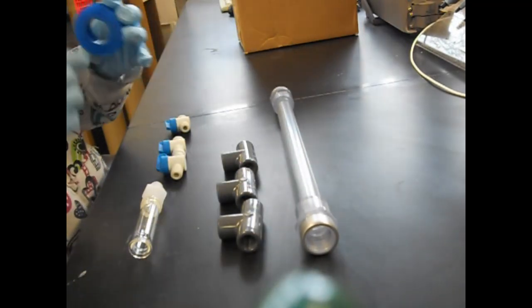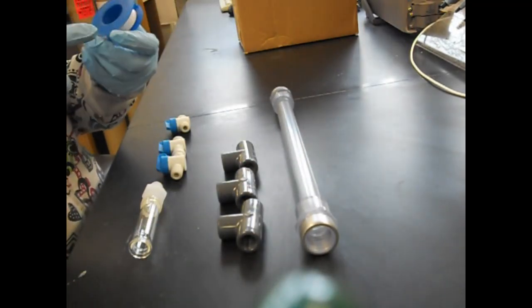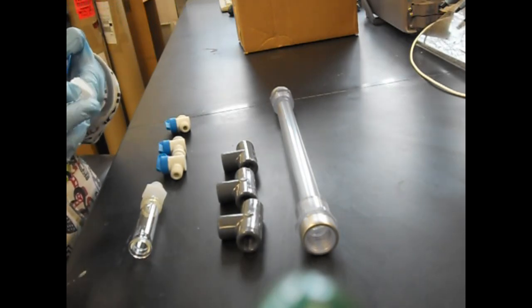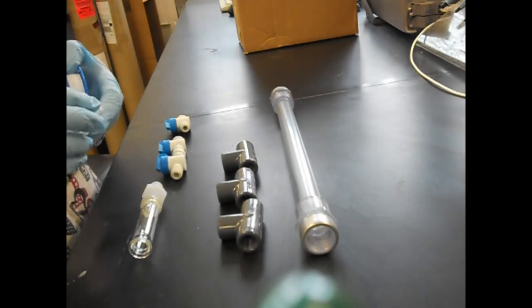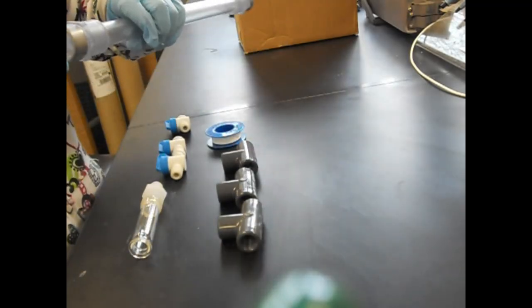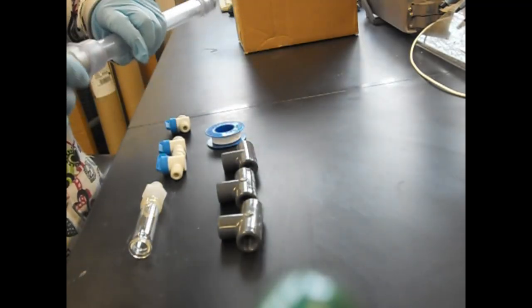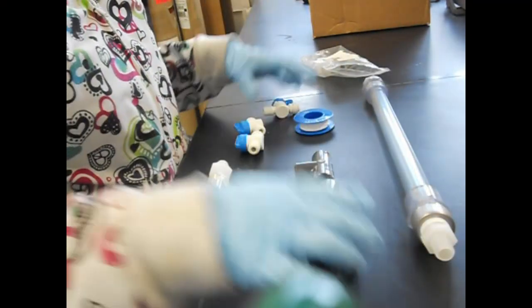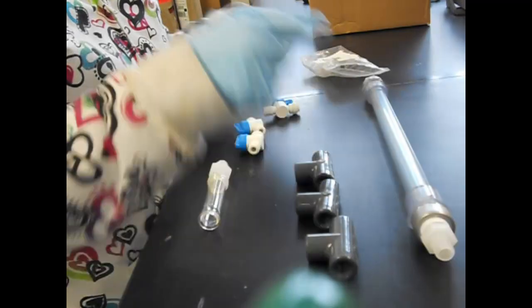Before you put it on, you need some glue, this kind of PTFE sealed tape. Then you put each of these tubes on each end.